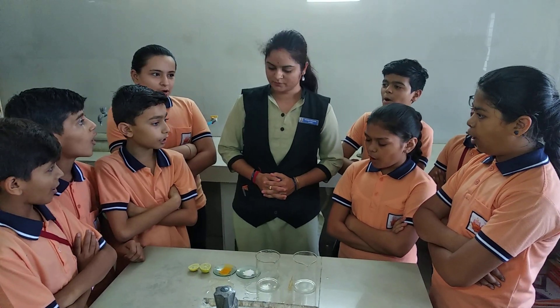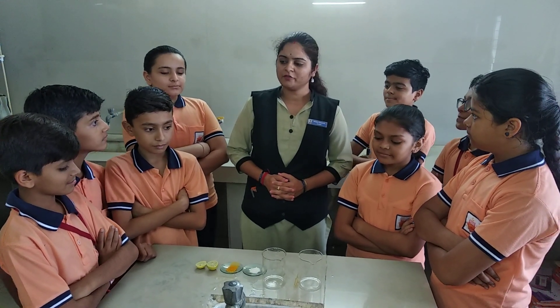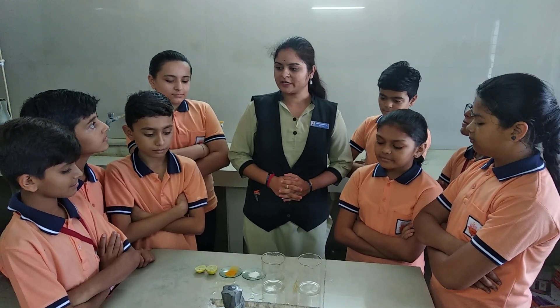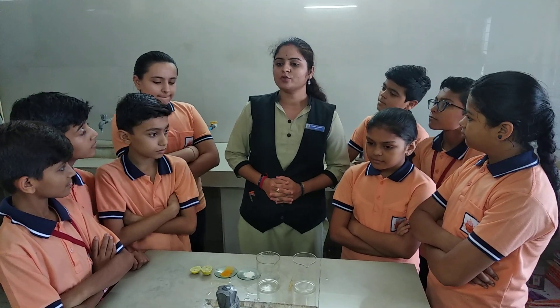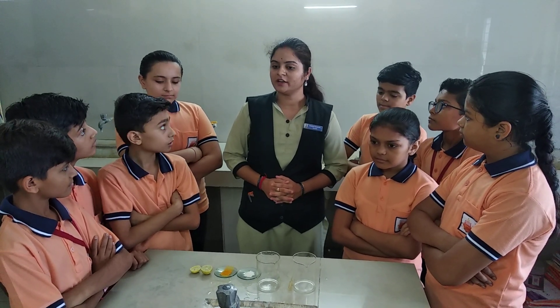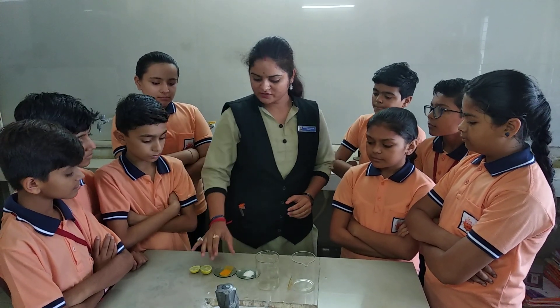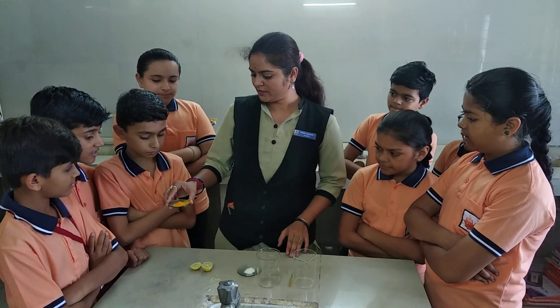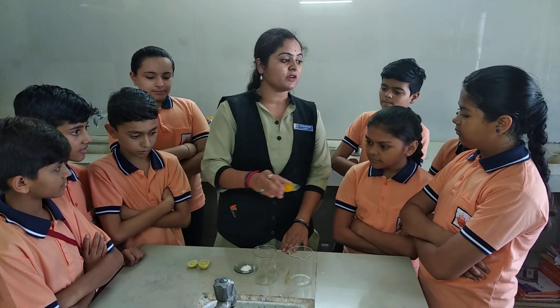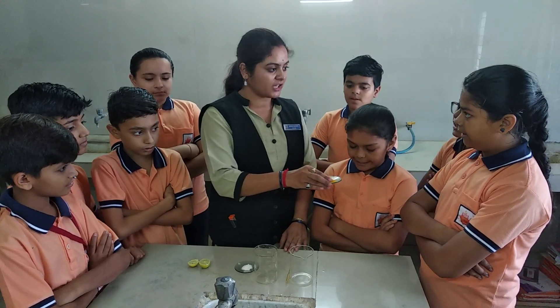Good morning students. Today we will perform a practical which is related to our natural indicators. Do you know this turmeric? This turmeric is our natural indicator.